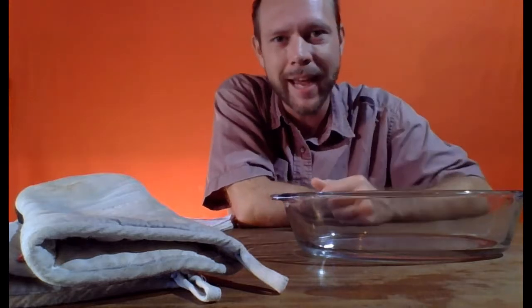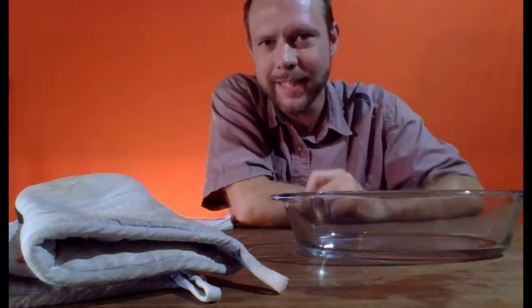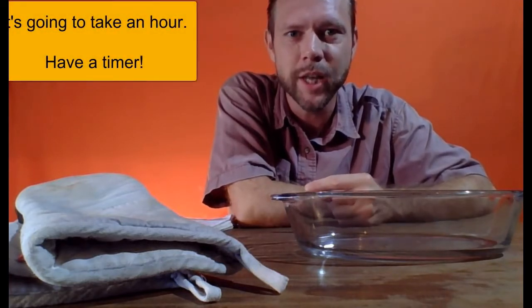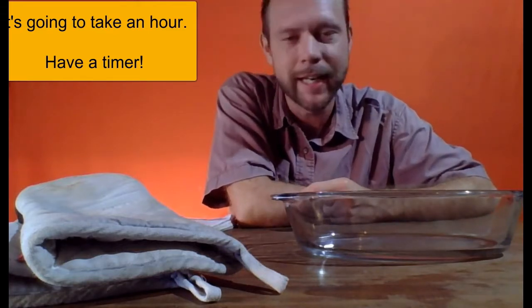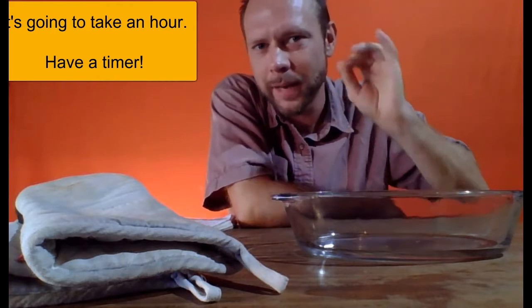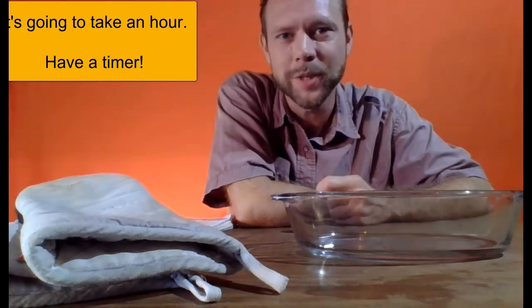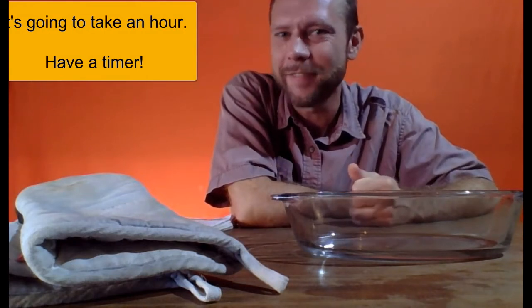So we're maybe going to have to bake our material in the oven for over an hour, and you know, you can sit there and watch it for an hour. That would be the extremely safe way to do it. A lot of times we maybe put things into the stove and are doing something else off to the side, even in another room of the house, right? Be aware there's usually a timer on the stove, or get a timer, set it for a half hour, set it for an hour, right? Don't fall asleep and let the oven run overnight, for example. That is not a safe situation.